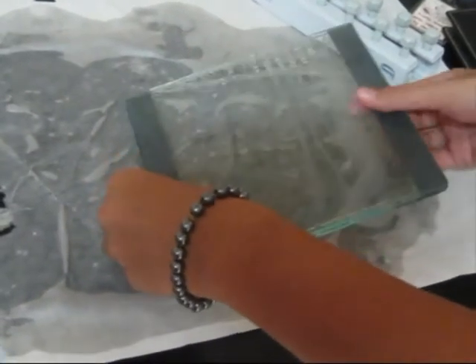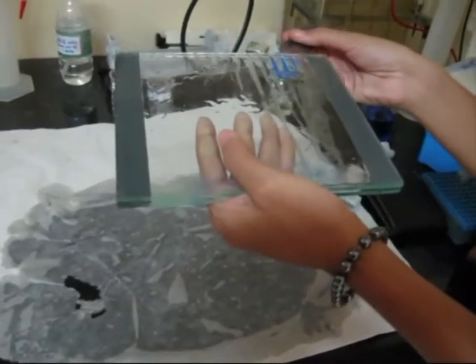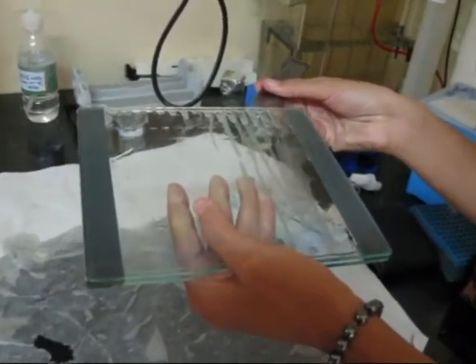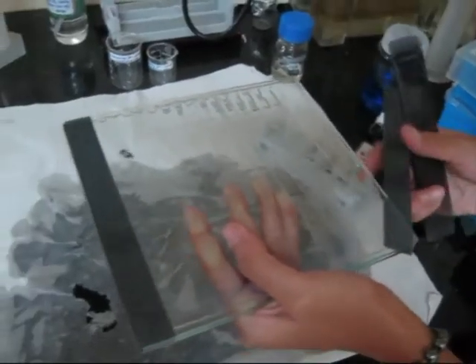The gel plates are taken out and the spacers are removed. The gel plates have to be handled carefully, since the gel is highly fragile.